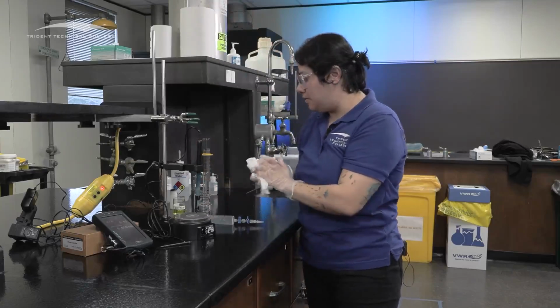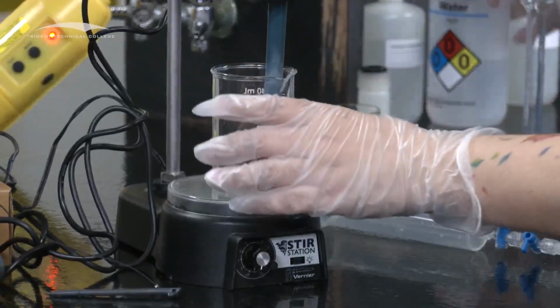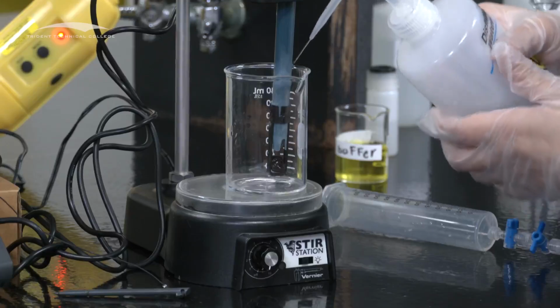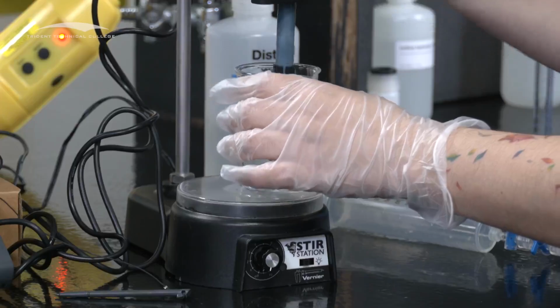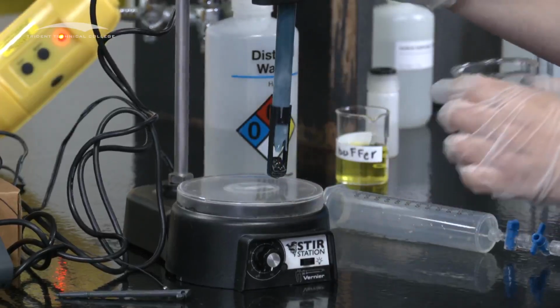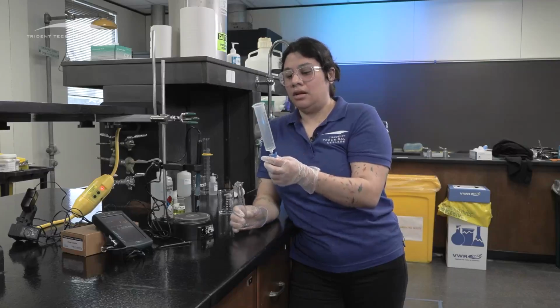And then it helps if you have some water ready. Or if not, make sure that you have your distilled water. So you rinse it. You want to make sure that you rinse it in between uses. And I'm going to leave this in there for now. Let me show you. All right. The next thing to do, and probably the hardest one, is going to be to calibrate your burette.